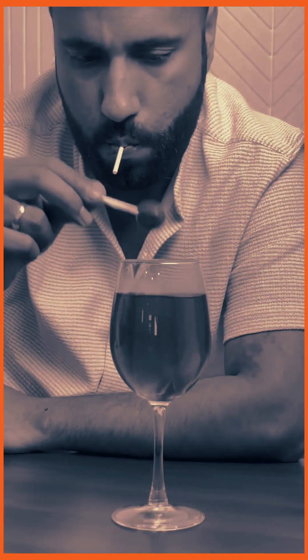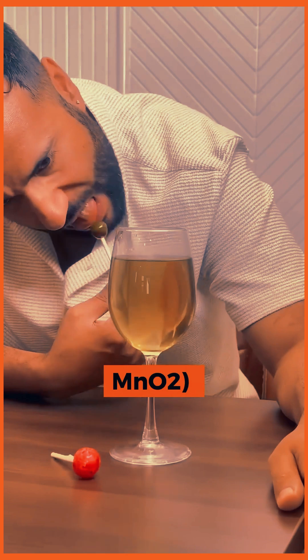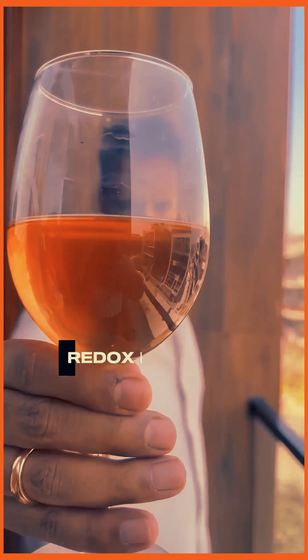This makes the color green. The reaction is furthered and makes MnO₂, whose color is yellowish, and it gradually gets darker. So basically a redox reaction is happening here. Now don't drink this drink by mistake, or you will die a bad death.